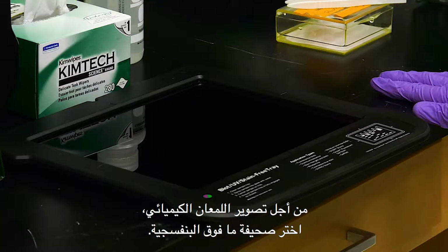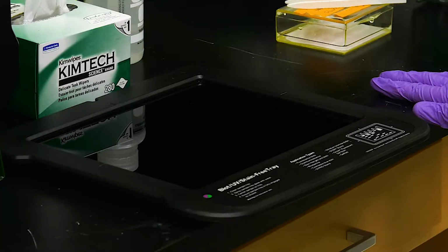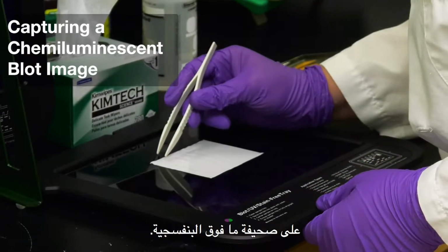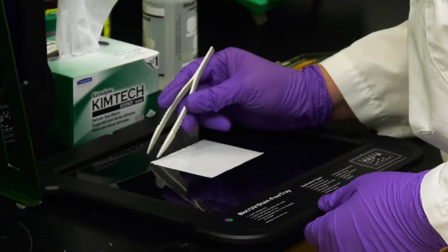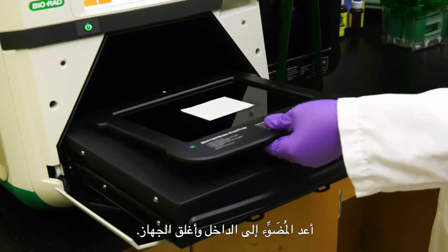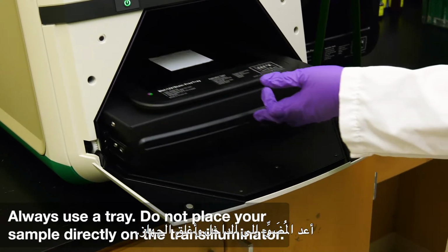For chemiluminescent blots, select the UV tray. After applying your substrate, center your membrane on the UV tray. Once you are satisfied with the position, push the transilluminator back in and close the drawer.